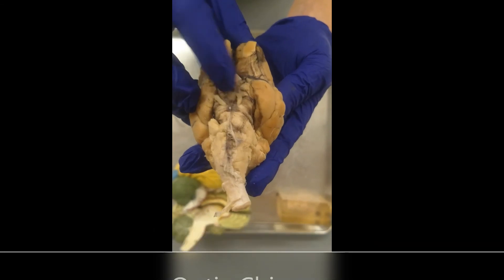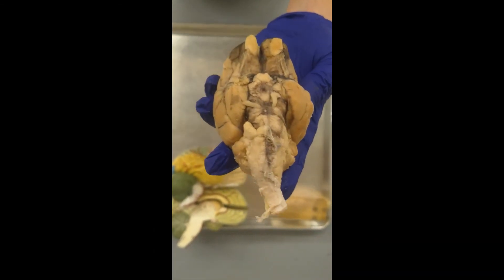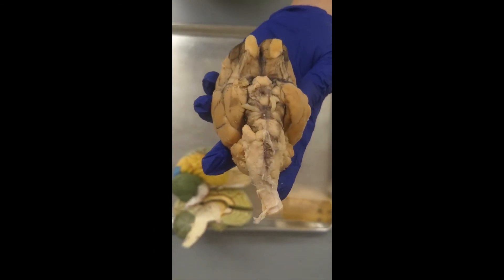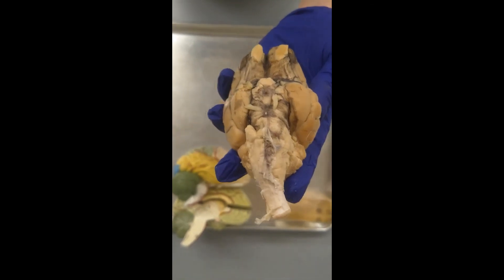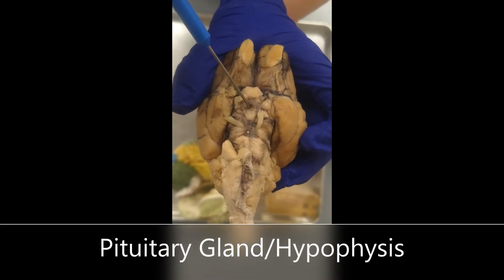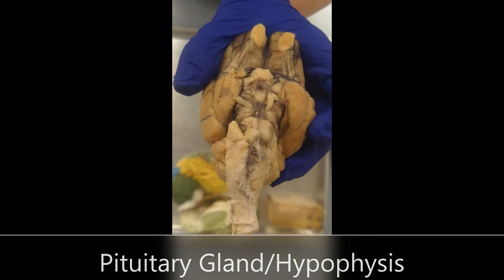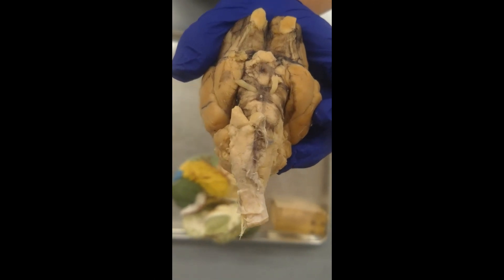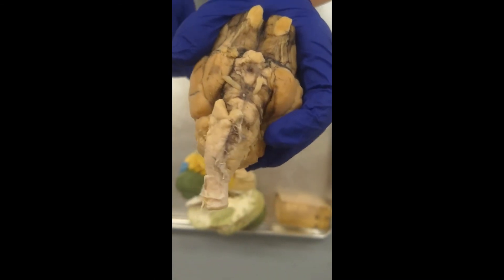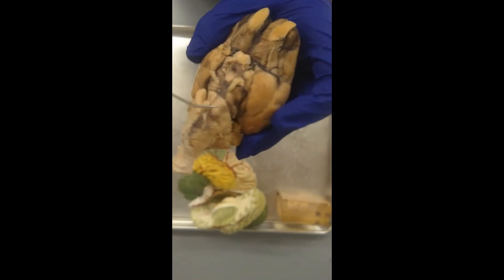The other thing is going to be the pituitary gland, or hypophysis. This has been cut off — this is right where the pituitary gland would sit. It is also called the hypophysis.